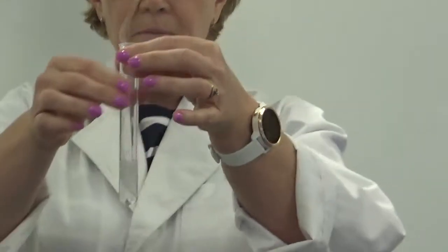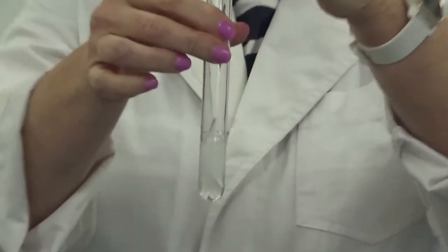What can you see happening? What evidence can you see there that this is a chemical change?